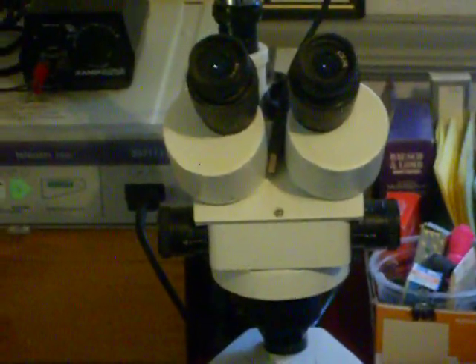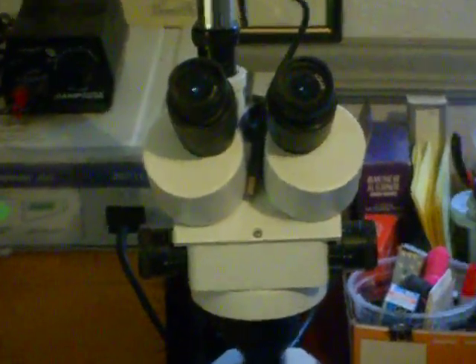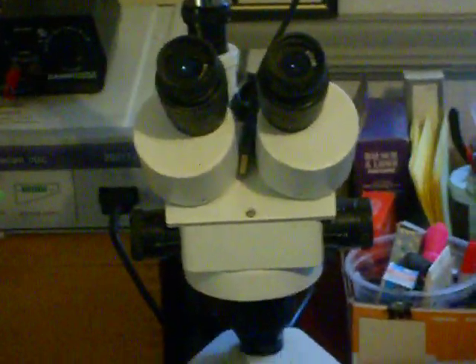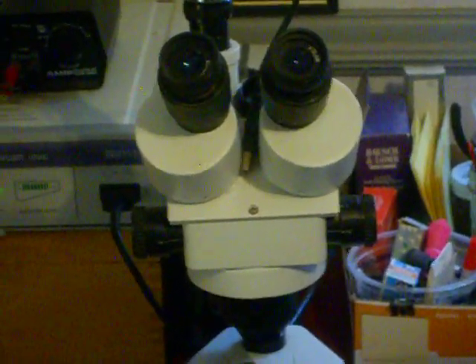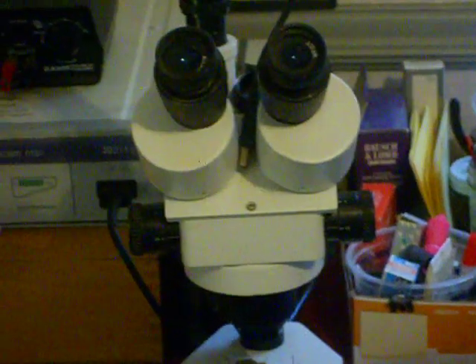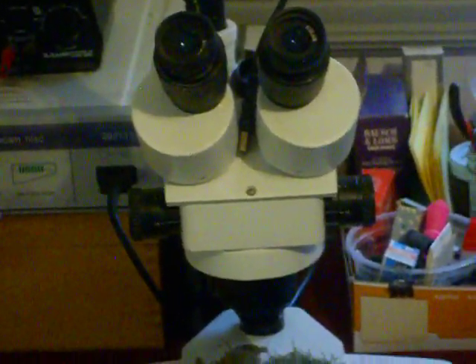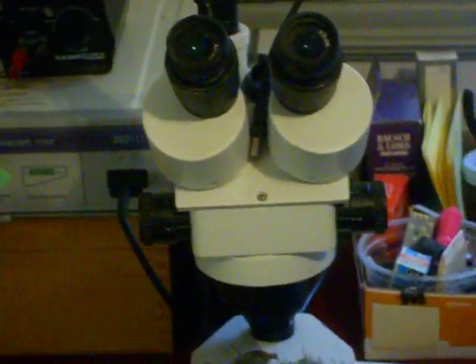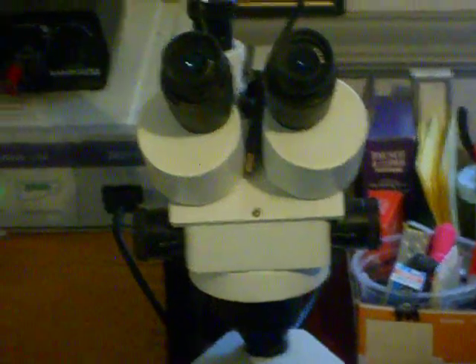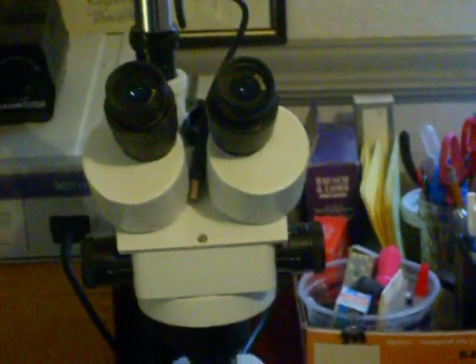And then I hope to have case studies that I will try to put up on YouTube. There'll be examples showing you first field symptom photos, what my thought process is, then how we go about actually taking samples from incubated turf and what I'm seeing microscopically. It's going to be crude, it will be low tech, but I think hopefully effective. So that's my first video, and let's see how long it takes to get up on YouTube.